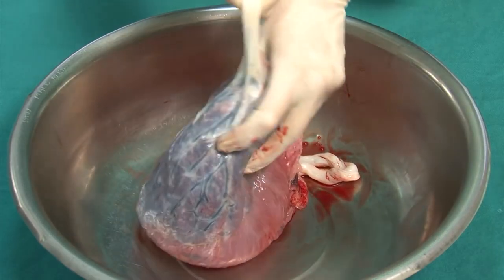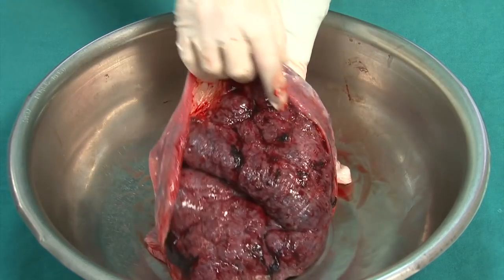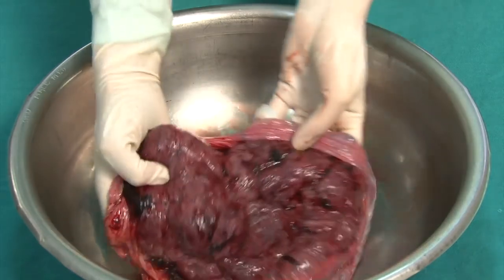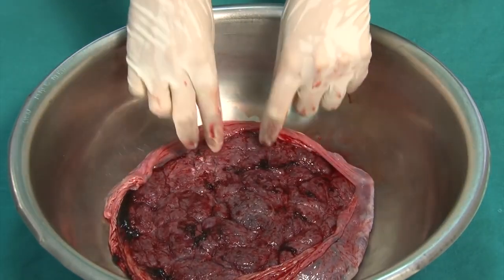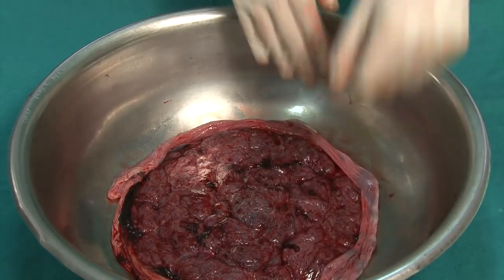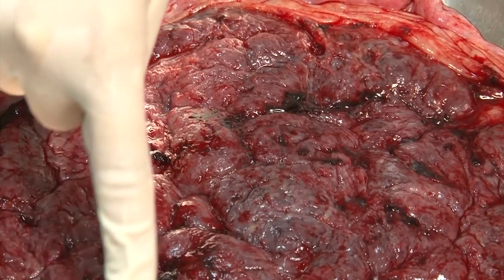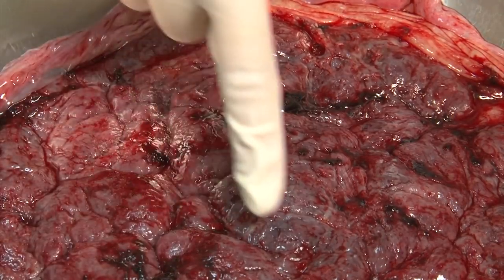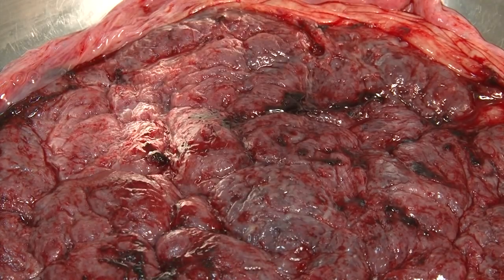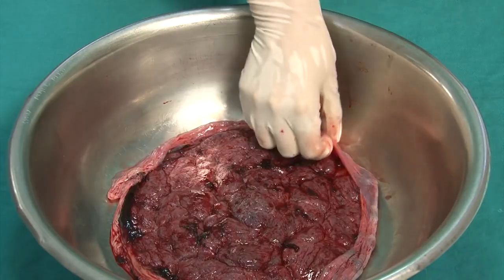Following the examination of the fetal side, the placenta is turned over to look at the maternal side. The normal placenta at term is a disc-shaped organ which is fairly symmetrical. It is 2 to 4 centimeters thick and has a diameter of about 20 centimeters. The surface has a maroon-red color and is divided into lobules called cotyledons. They need to be examined to make sure that there are no gaps, which would indicate a missing cotyledon.